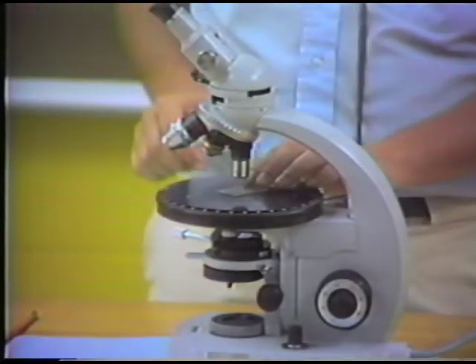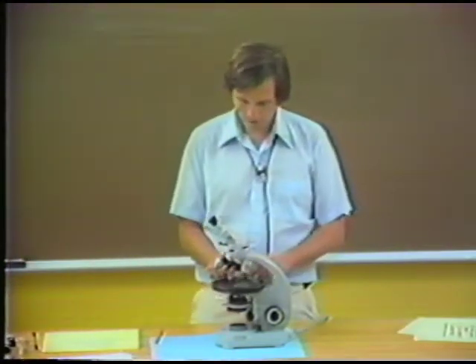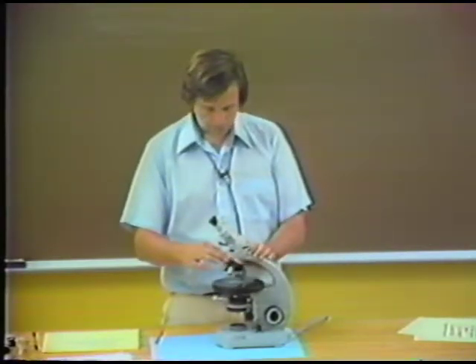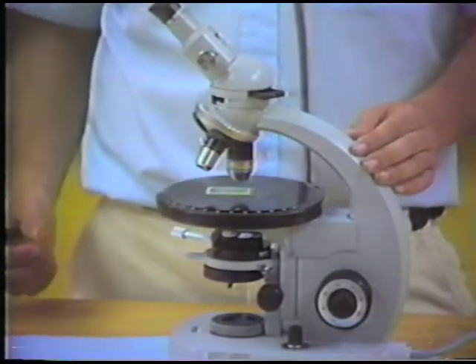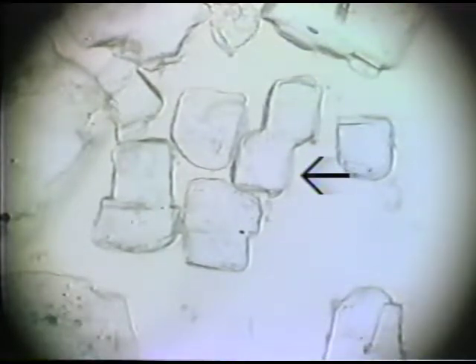So we have anisotropic and isotropic minerals. Now, another example I have is a prepared mount of grains of the mineral halite, which is another isotropic mineral. And again, if we look at this in the plane polarized light, you can see the outline of the cubic halite crystals. And I just point out that the dodecahedral shapes of garnets and the cubic shapes of halites are very important identification criteria. And if you can see crystal form, this can help you identify what particular minerals these are.